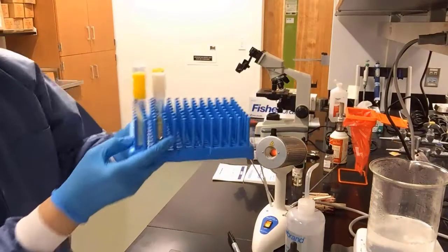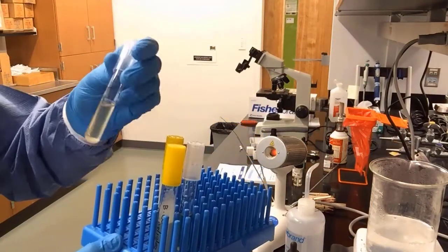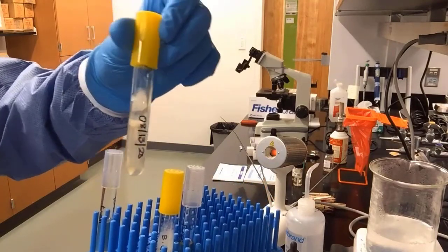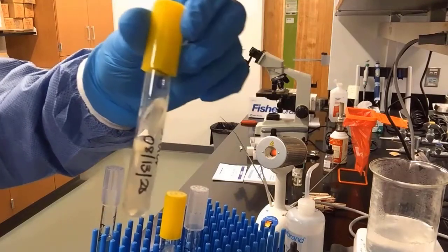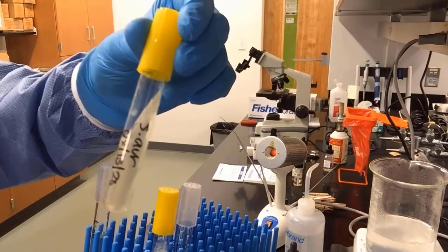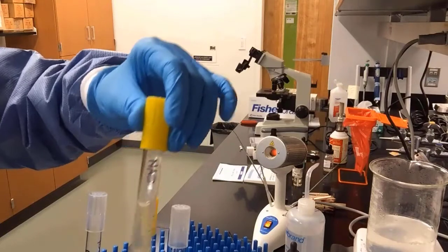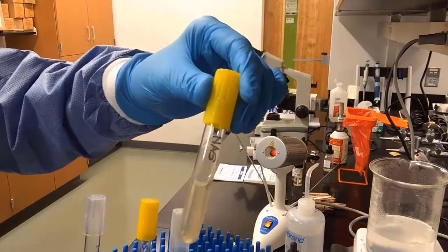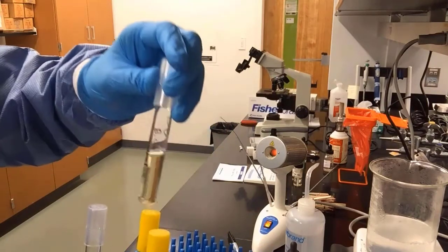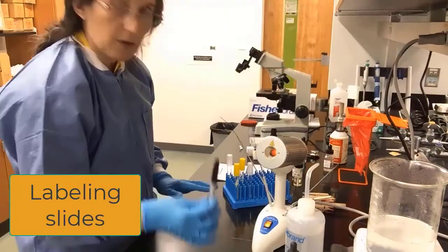Moving on to the bacteria that are used in this lab, we have E. coli in a liquid medium, Staphylococcus aureus in a solid slant. I don't know if you can see, there's some film of bacteria growing on the slant. So this is Staphylococcus aureus. And we also will use bacillus. You can see a film there growing on the slant. Some instructors may prefer liquid bacteria, bacillus, actually liquid for all of them.